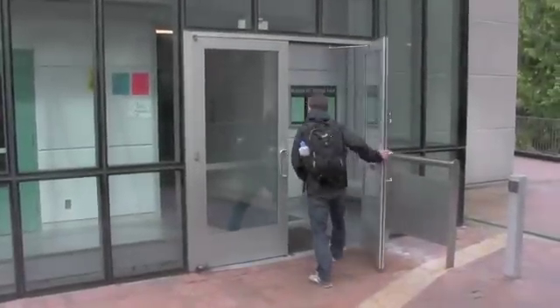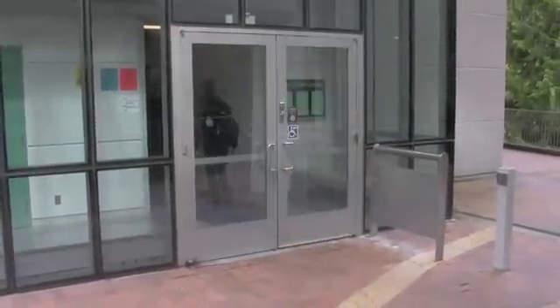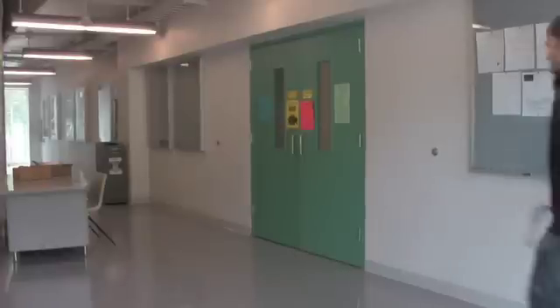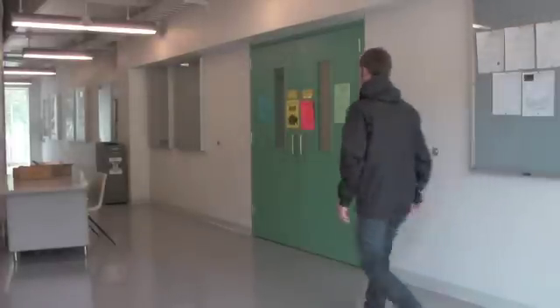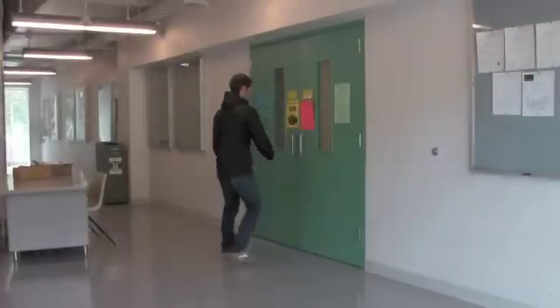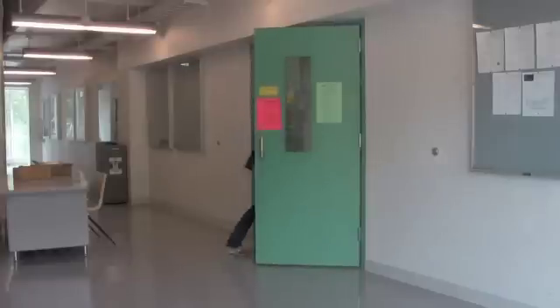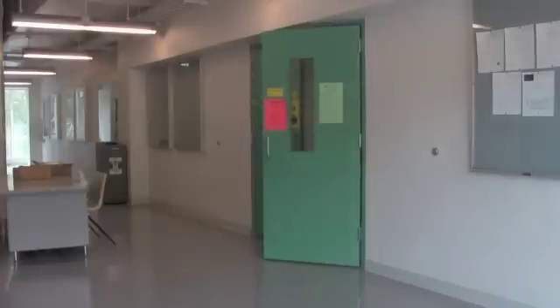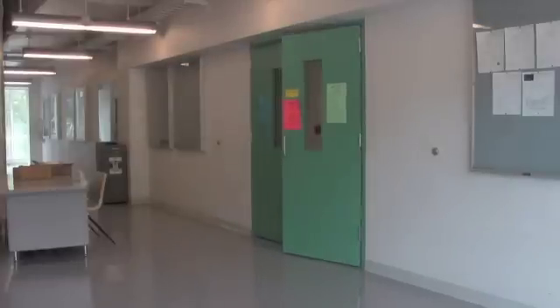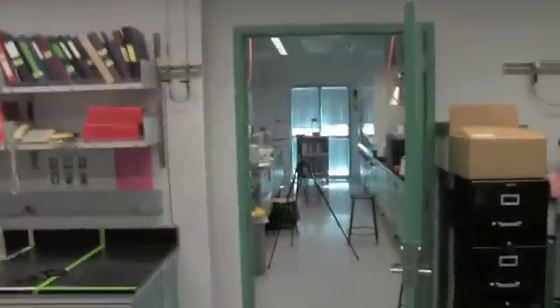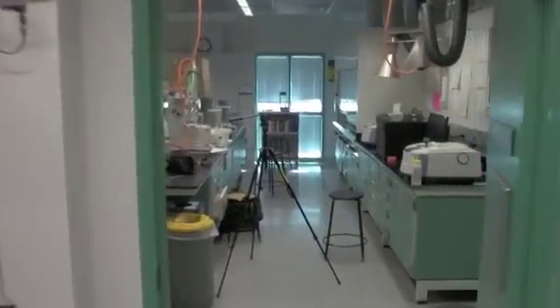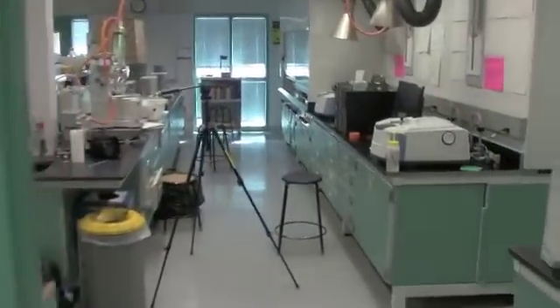The FTIRs are located on the third floor of the chemistry building in Organic Chemistry Lab number 310. A chemistry professor should be consulted before using these machines. There are two FTIR devices in the lab, both located in the northwest corner of the lab.